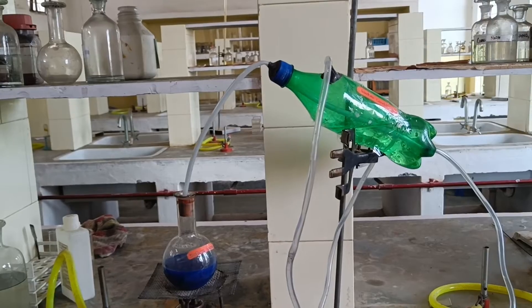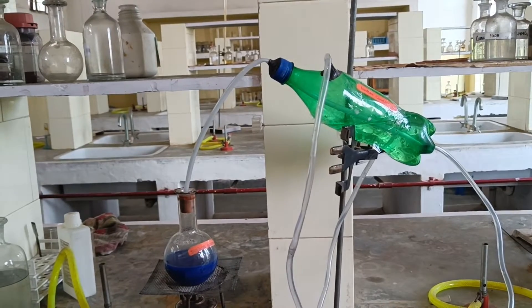Today I am going to explain the distillation process. Class 9 covers the definition of the distillation process and activity. Today we are going to practicalize this model.